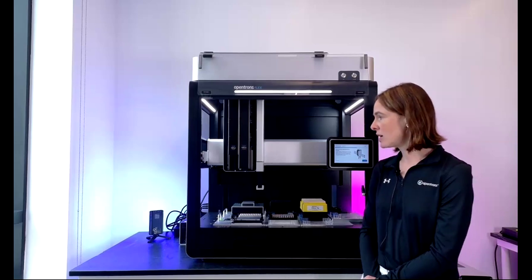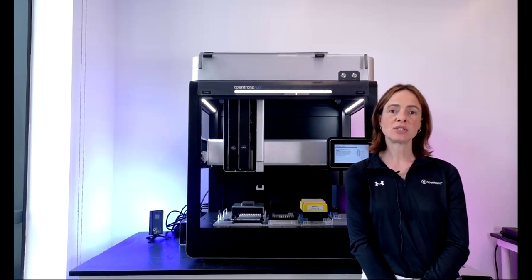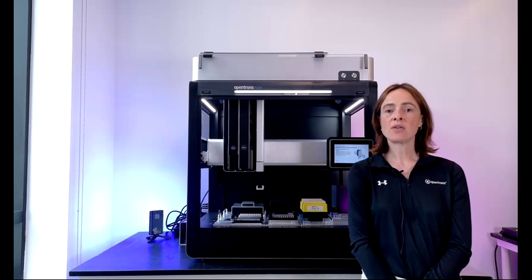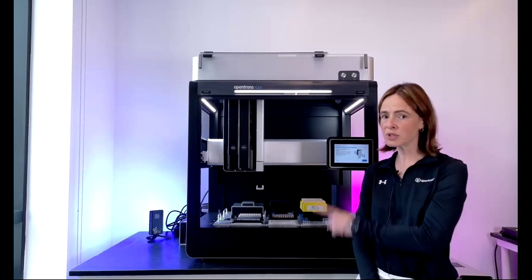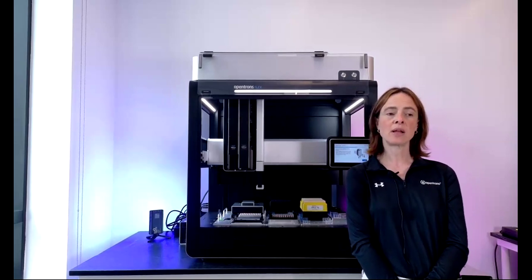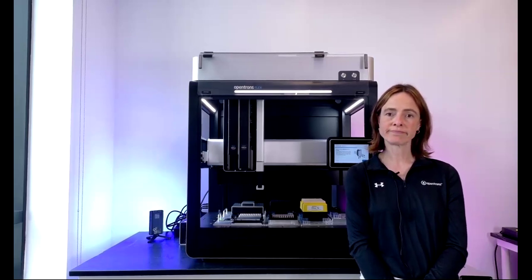Before we get started talking about the robot, I wanted to say a few things about Opentrons ethos and why we exist. It's our mission to support scientists doing groundbreaking, valuable research with powerful, accessible lab automation. Our aim is to really free you to do more than pipette and be able to focus on science. We've helped thousands of labs across the world automate their workflows. And with the Opentrons Flex, which is our newest generation robot, we're excited to show you how it can help you and your lab increase your throughput and automate your workflows.